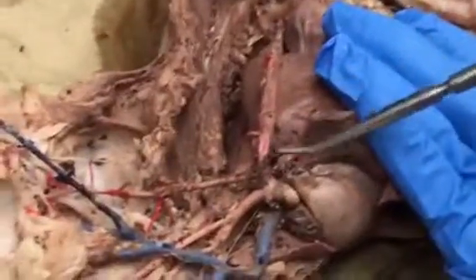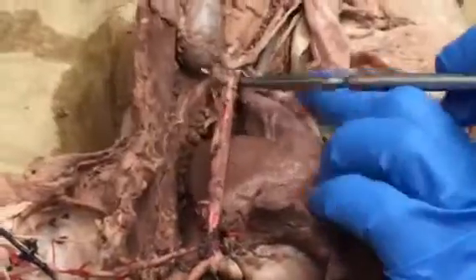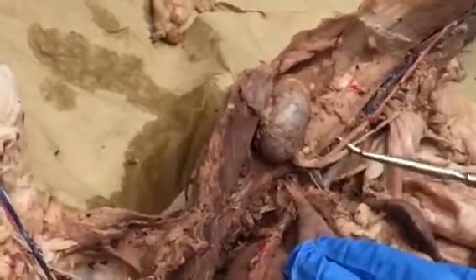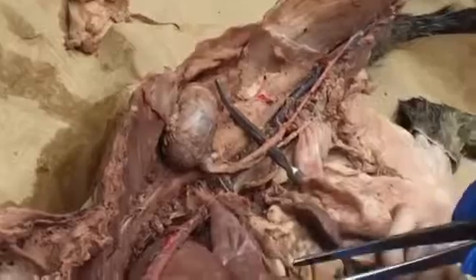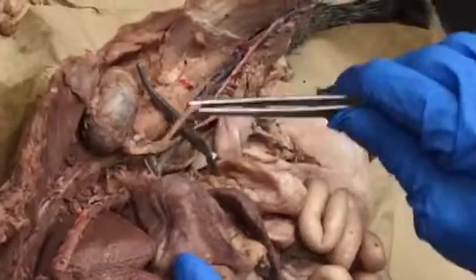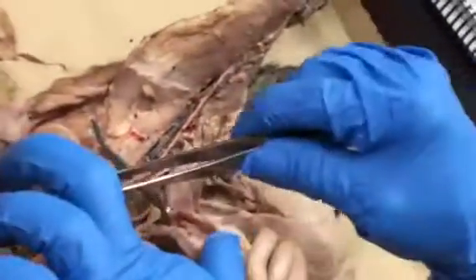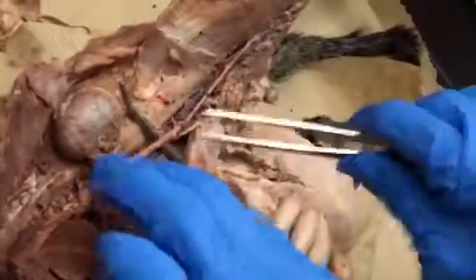Again, the arch of the aorta is going to follow down into the thoracic area as the thoracic aorta. It's going to continue on down here as this big vessel called the abdominal aorta. So if it's superior to the diaphragm muscle, it's the thoracic aorta. If it's inferior to the diaphragm muscle, it's the abdominal aorta. It's going to branch off once and go towards the kidney as the renal artery here.